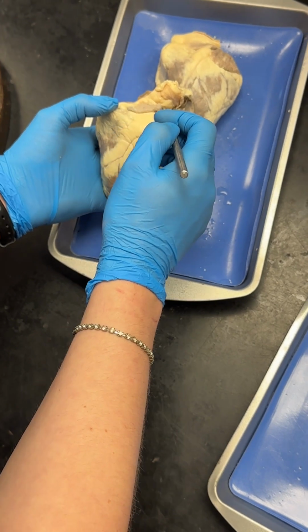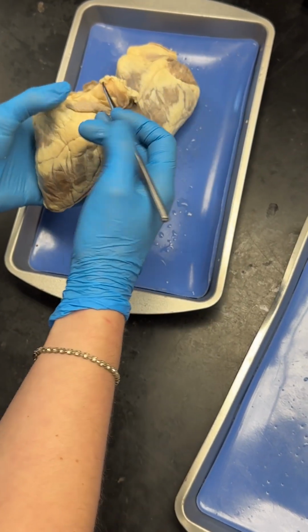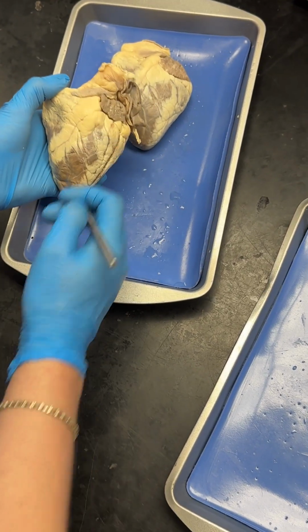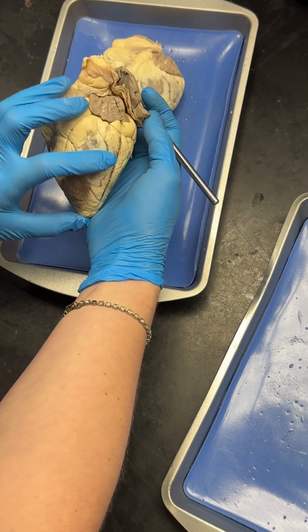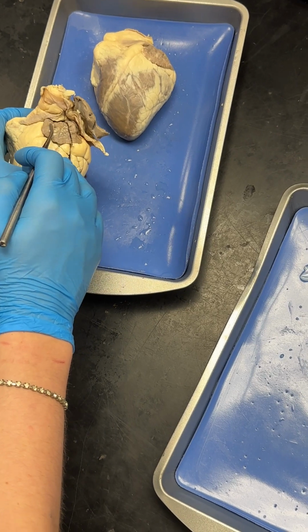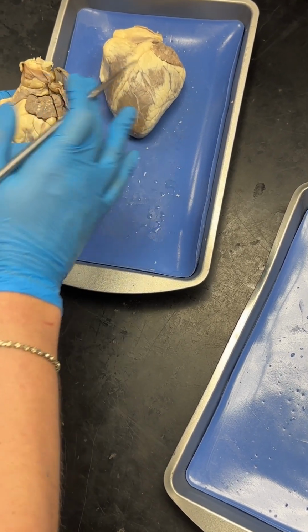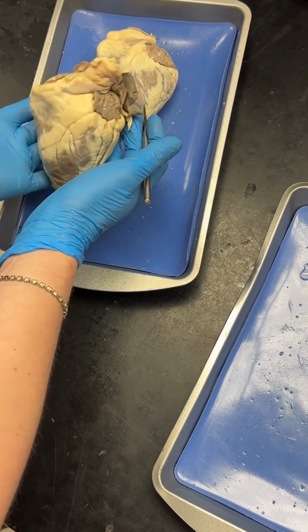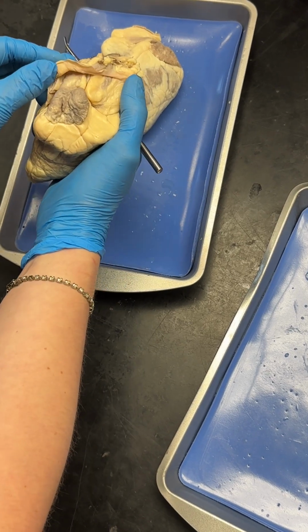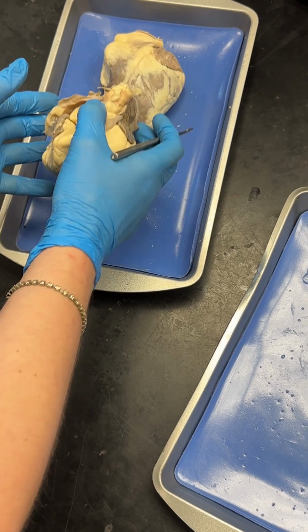So if you see this nice big vein, this is an artery. This is coming out. You see this nice big artery coming across, then it is the front of the heart. So you can see these are the auricles on the outside. So the auricles are basically extensions of the two atria. You don't need to know left and right just looking at it this way, because again, there's a lot of adipose tissue here, so it's just a level of difficulty that you're not expected to have at this point in the course.